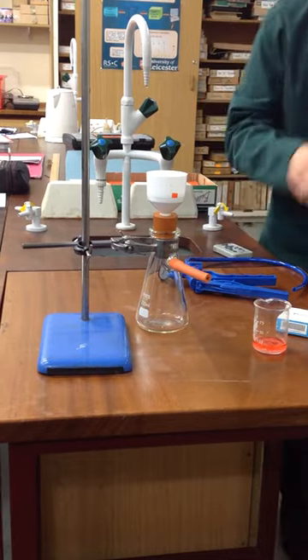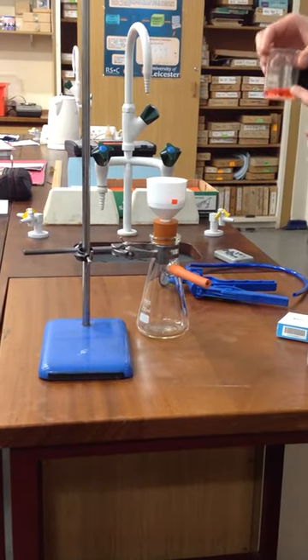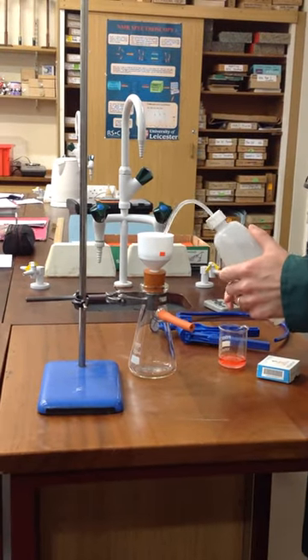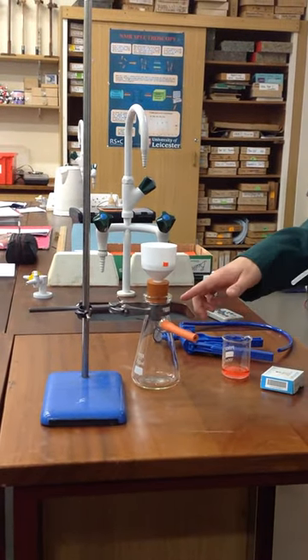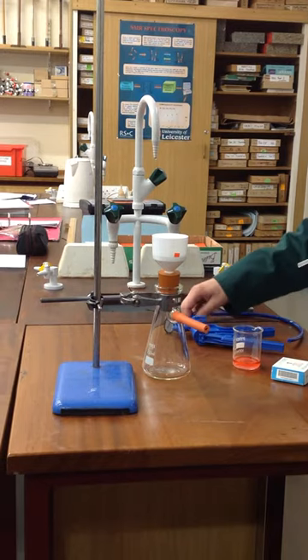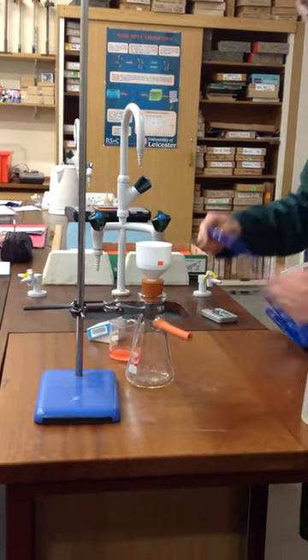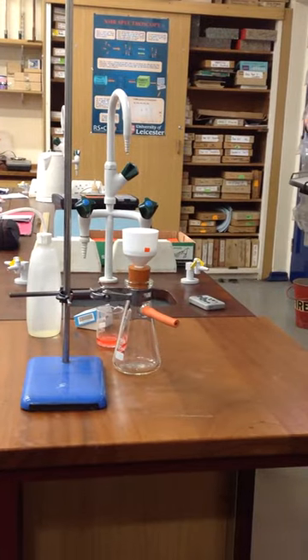Now whatever this solvent is that you've got your reaction mixture in, in this case it's water, you're going to just soak the filter paper with a bit of water, and you should be able to see a few drips, but it's not coming down very quickly.